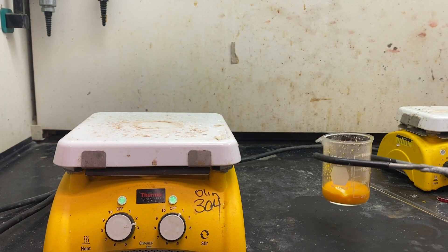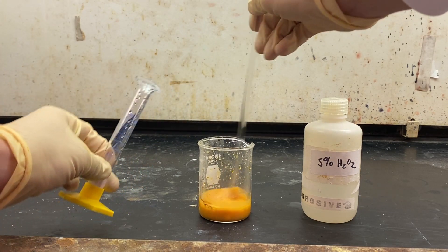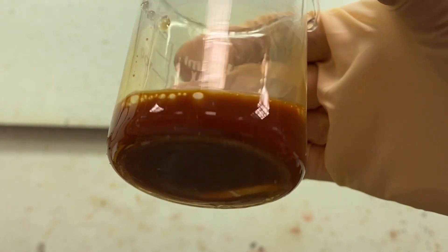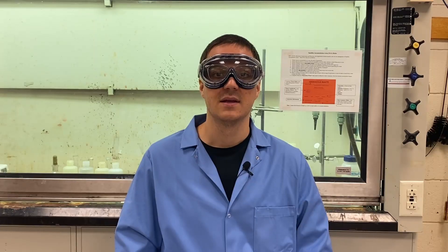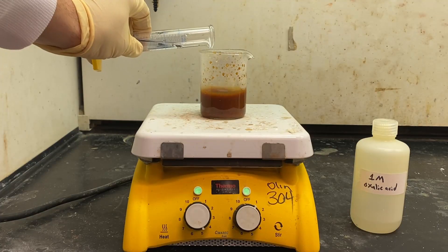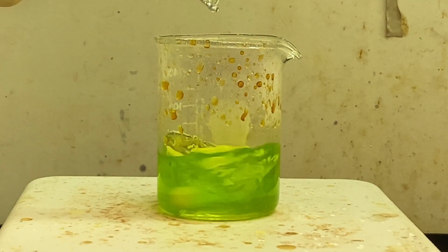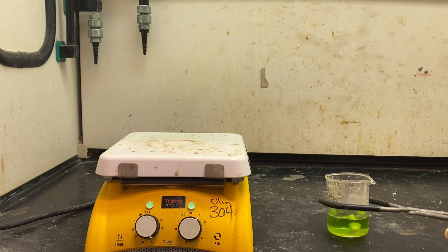Again, the beaker is removed from the hot plate. Five milliliters of 5% hydrogen peroxide are slowly added and mixed into the beaker. No yellow solid should be left in the beaker — if there is some, more peroxide can be added. The reaction is again heated to 75 degrees and more 1-molar oxalic acid is added until the solution turns clear. It may take about 14 milliliters. The beaker is then removed from heating and allowed to cool.